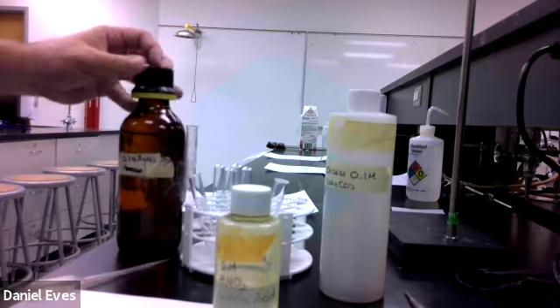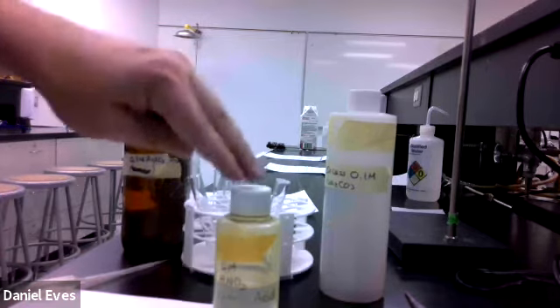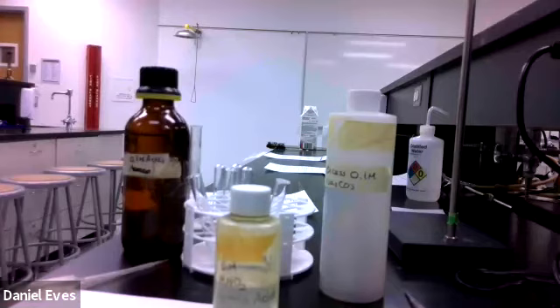And so when you write out your equation for that second part, because we've already written out an equation for the formation of the solid, what reacts with the acid is not everything that's in solution, because some of it is already ionized and floating free in solution. Some of it is in a solid, and so what happened was the solid went away, so that meant the compounds in the solid are what reacted with it. So the carbonate piece and whatever was attached to that carbonate was the starting material when we added the acid, and then when we get done with that, we should end up with water, carbon dioxide, and then the ions that would come out of that solid.